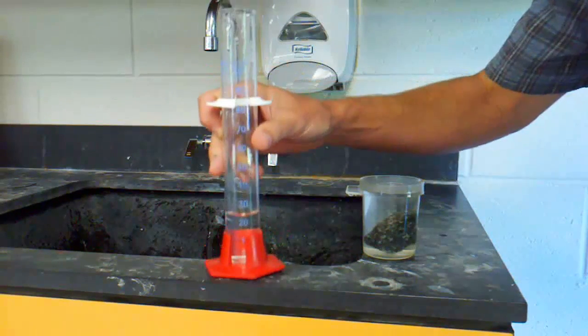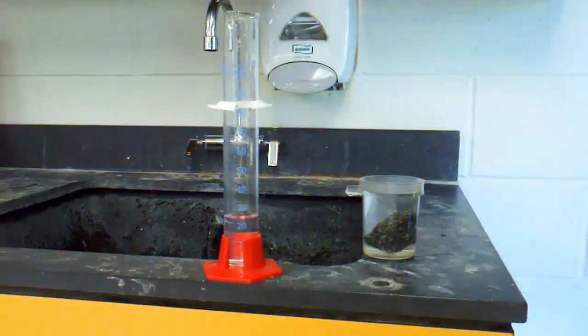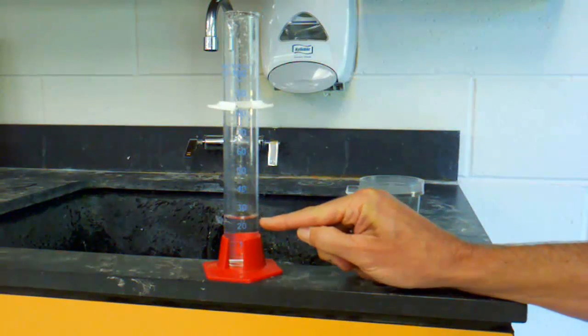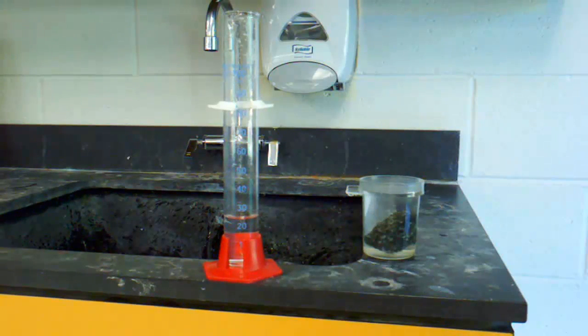Now, I'll set the graduated cylinder down and look carefully and see that the water in the graduated cylinder is equal to the volume of the rock. In this case, 23 milliliters.